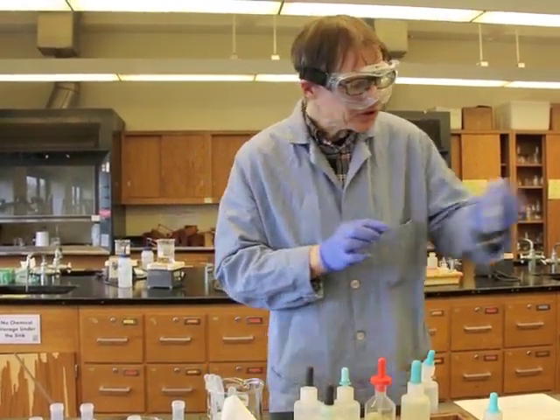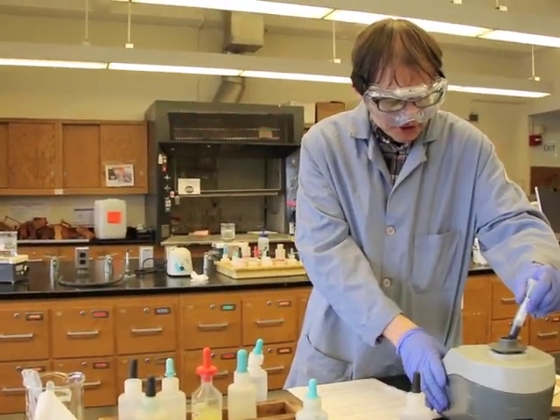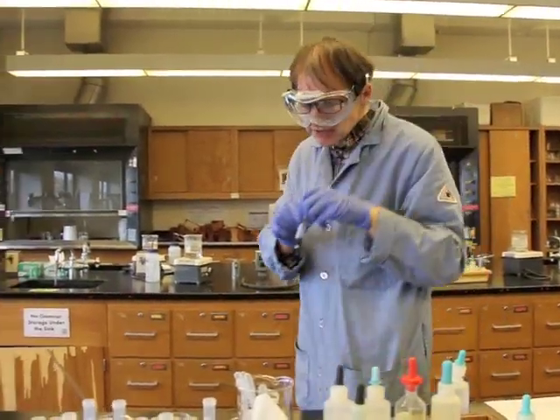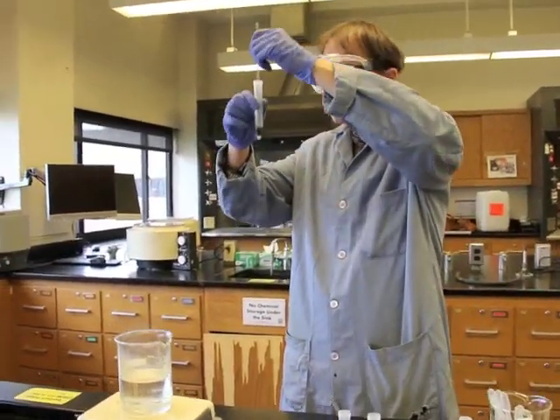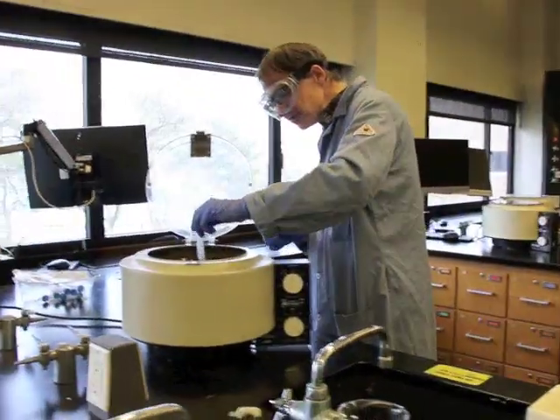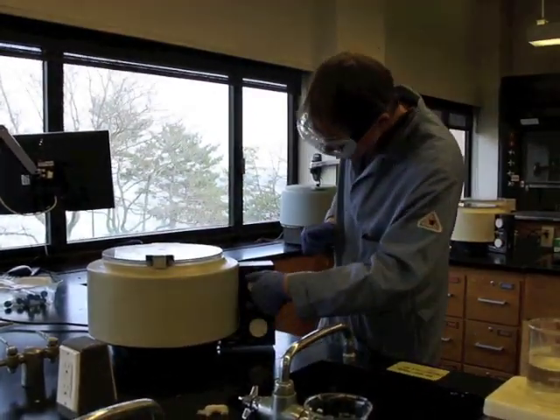Okay, now we're going to stir it. Vortex mixer will stir this very nicely. Okay. Notice there's still some solid down there. So again, we can come back to our old technology, mix that in really nicely. Now the next step is to centrifuge it, and if we get a black solid, we know we have our result.